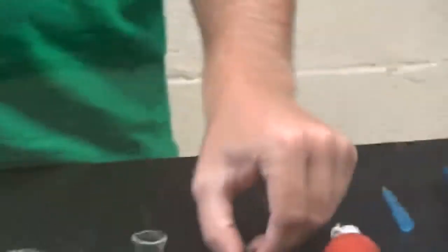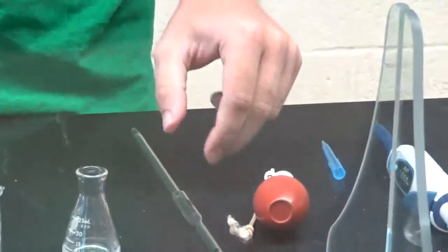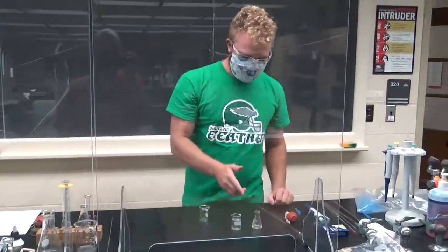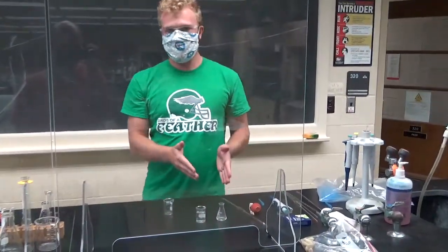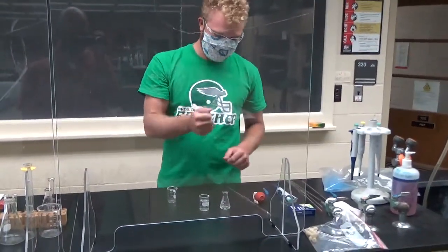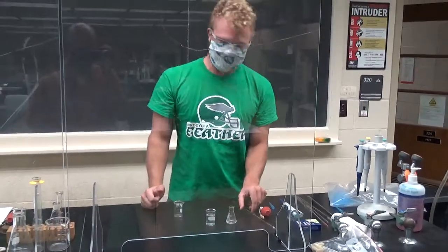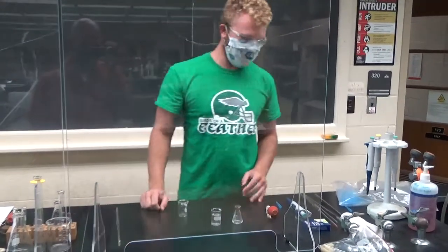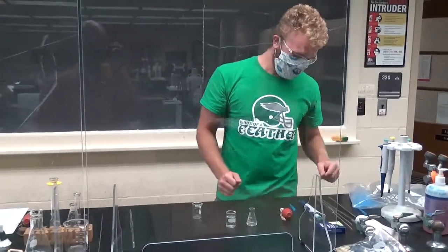While you're there, Wes, can you show them that there's still a little bit of liquid in the pipette at the tip? At the tip here, there's a little bit of liquid. You don't ever want to blast that liquid out with air from the pipette bulb. Another thing, a procedure that might not be said in this lab, you never want to pipette out of an Erlenmeyer flask because you can end up breaking the tip of the pipette. Something you could get scolded for.